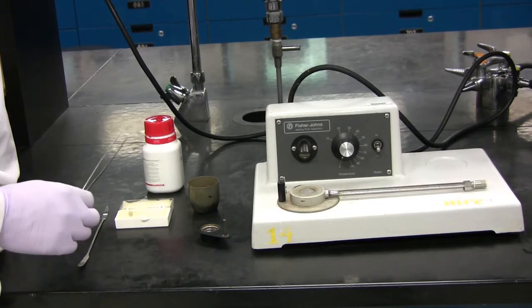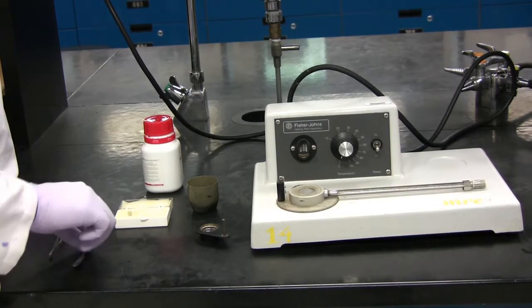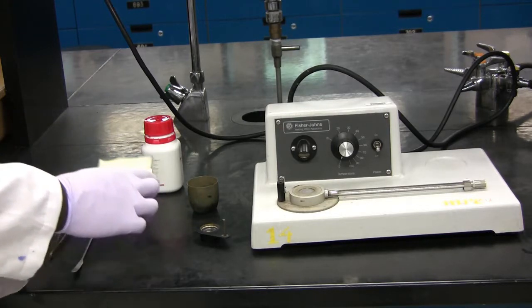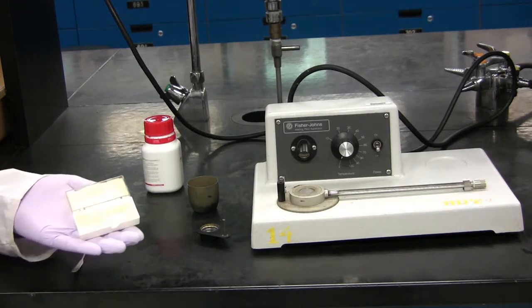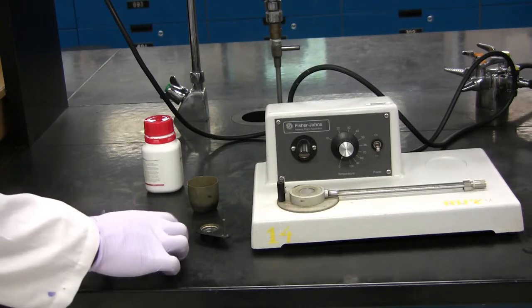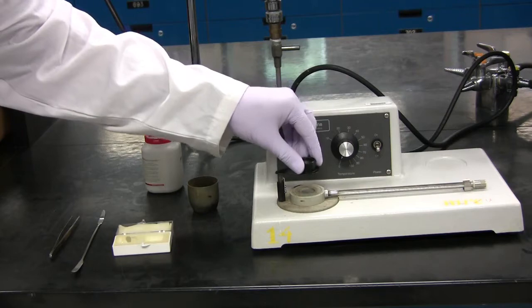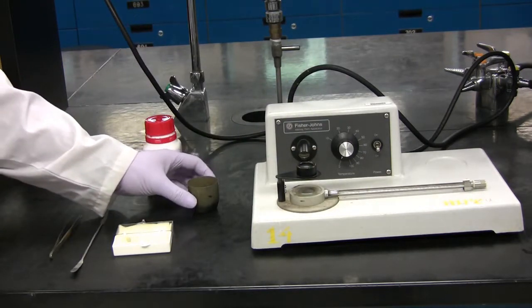You will require a set of tweezers, a spatula, glass cover slips, a magnifying lens, and a brass crucible.